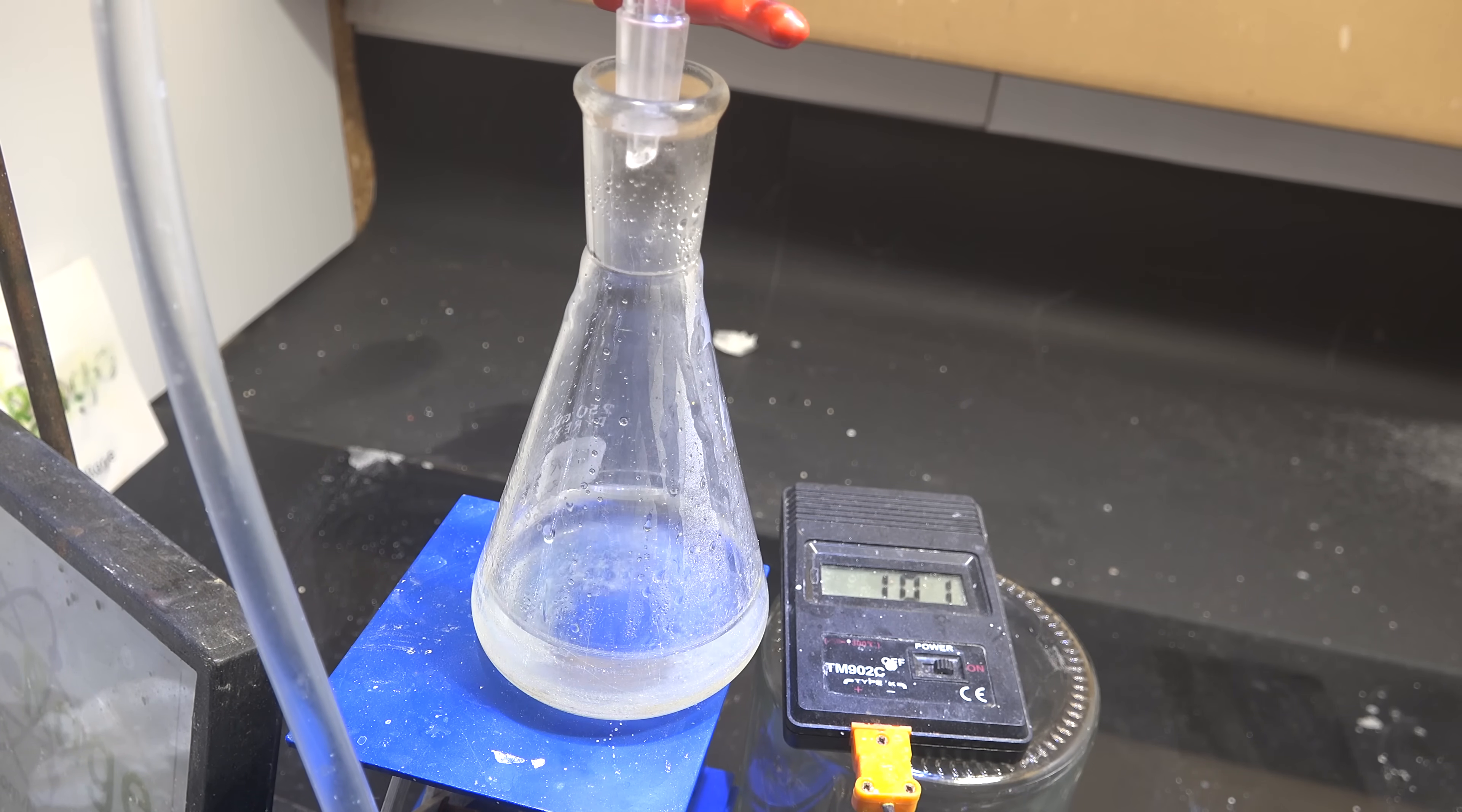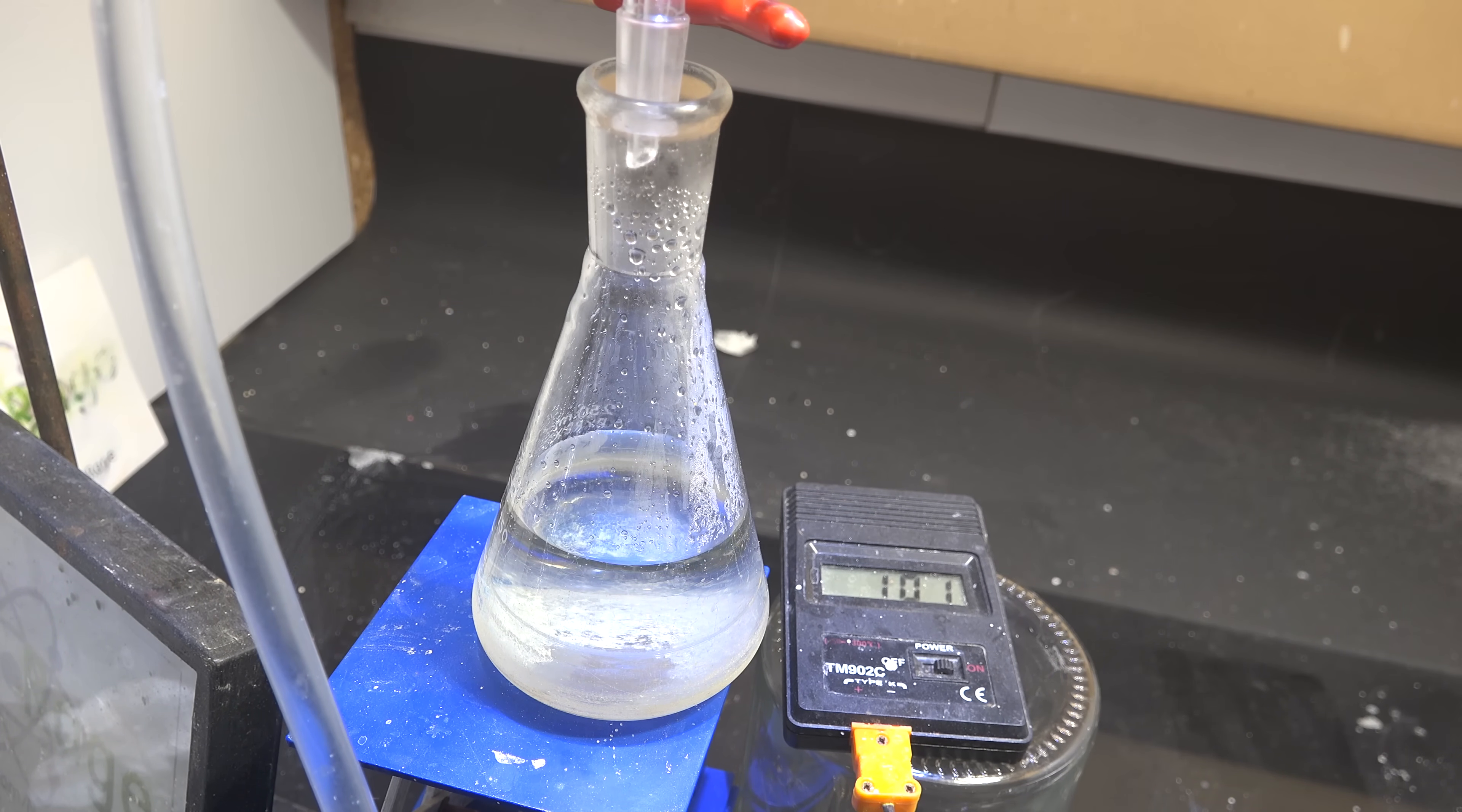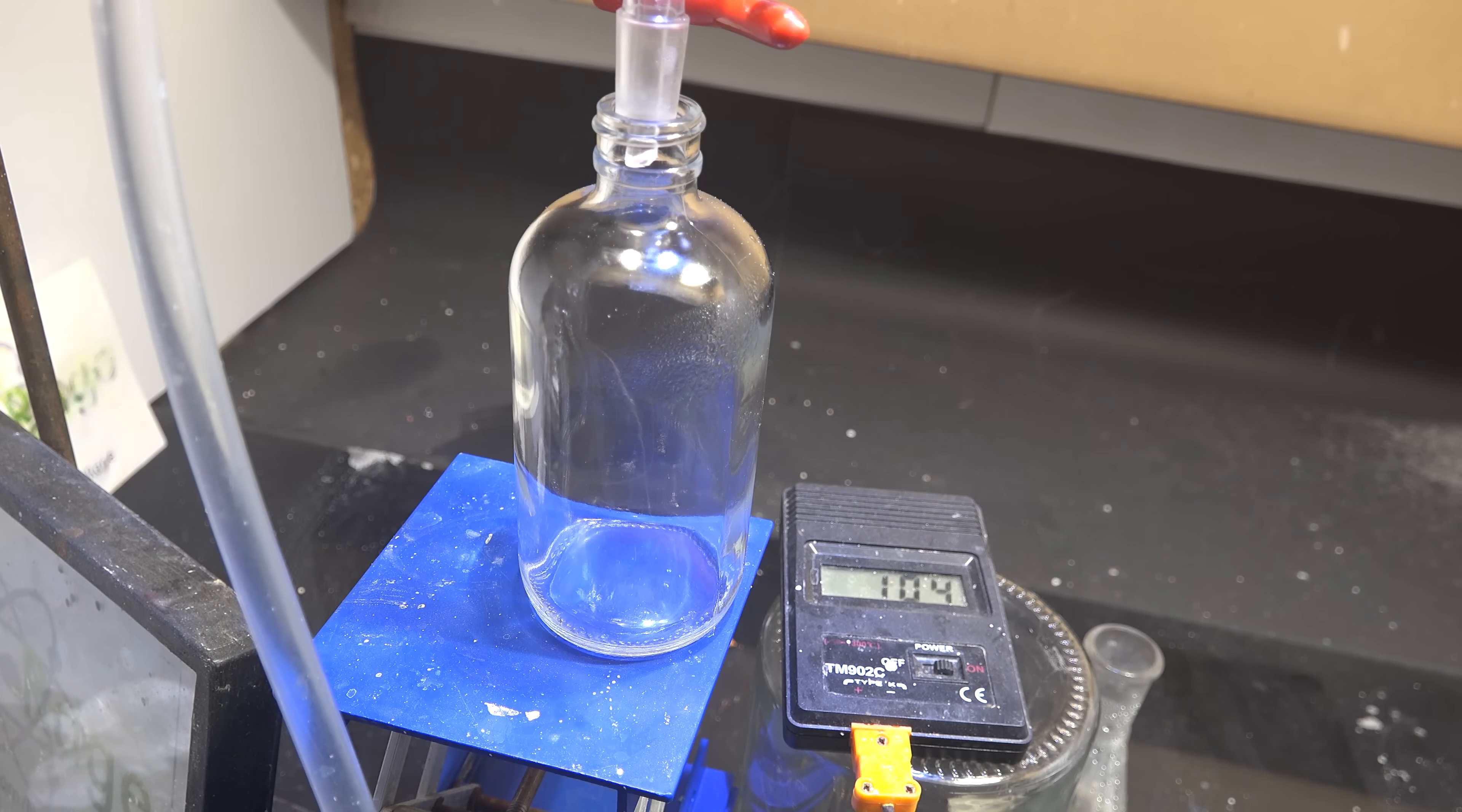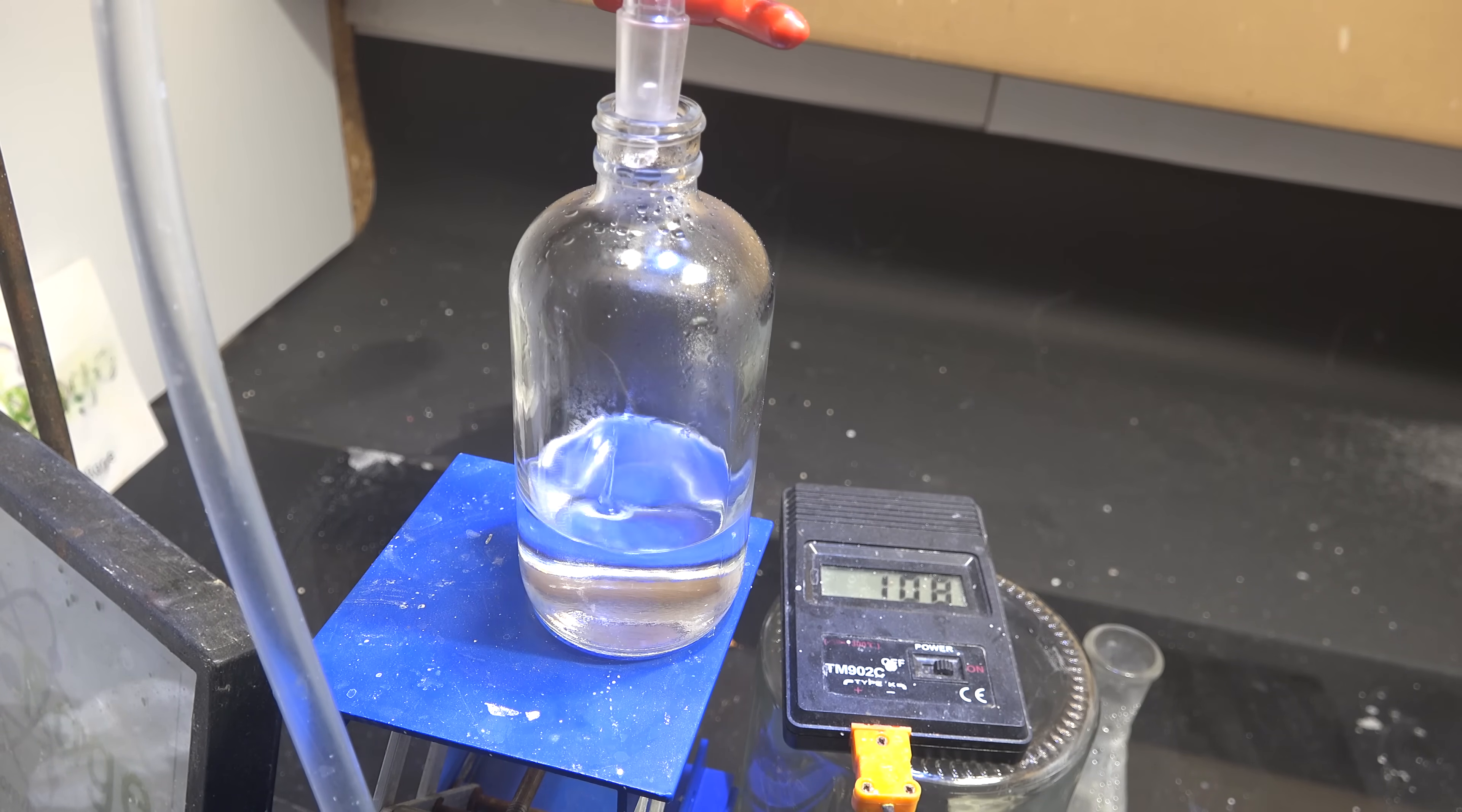Assuming everything goes smoothly and nothing interrupts you like stupid bugs named Gary, continue distilling off the water at around 100 degrees celsius and switch up the receivers at 104 degrees celsius. At 107 celsius we'll be collecting a high boiling azeotrope of formic acid.